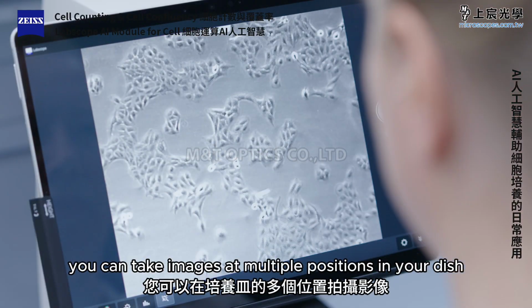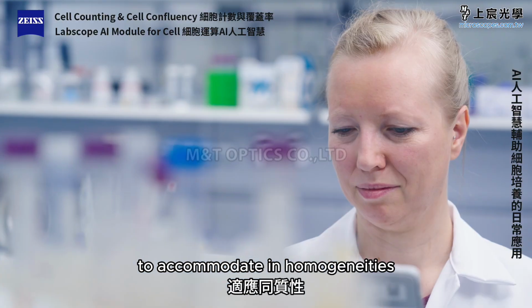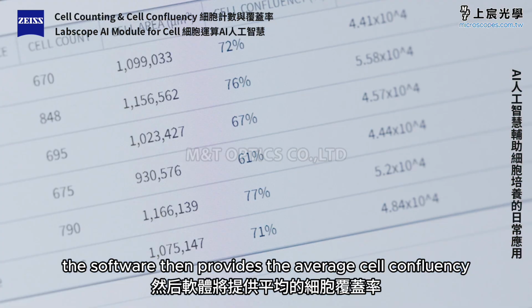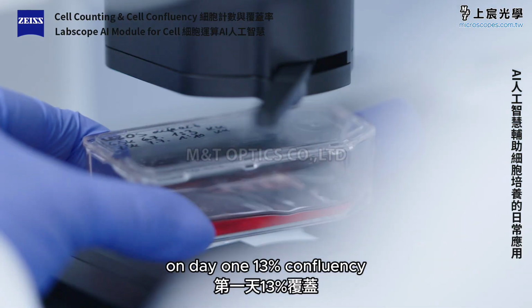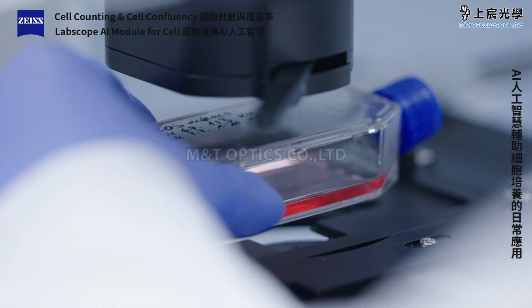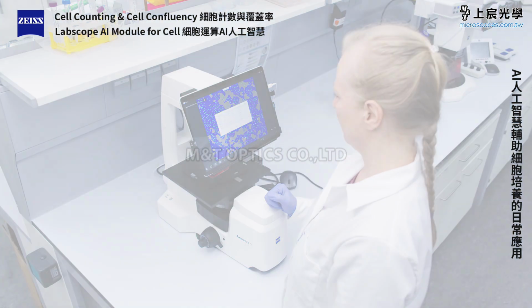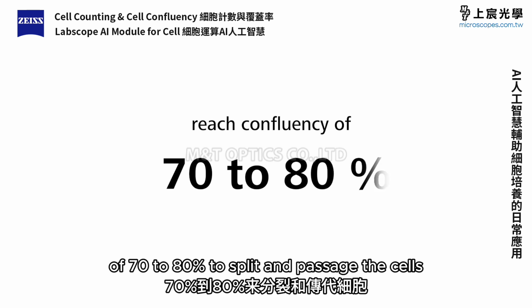You can take images at multiple positions in your dish to accommodate inhomogeneities. The software then provides the average cell confluency for your cell population at a glance. On day 1, 13% confluency. On day 2, 49%. On day 3, 71%. Typically, you will need to reach a confluency of 70 to 80% to split and passage the cells.